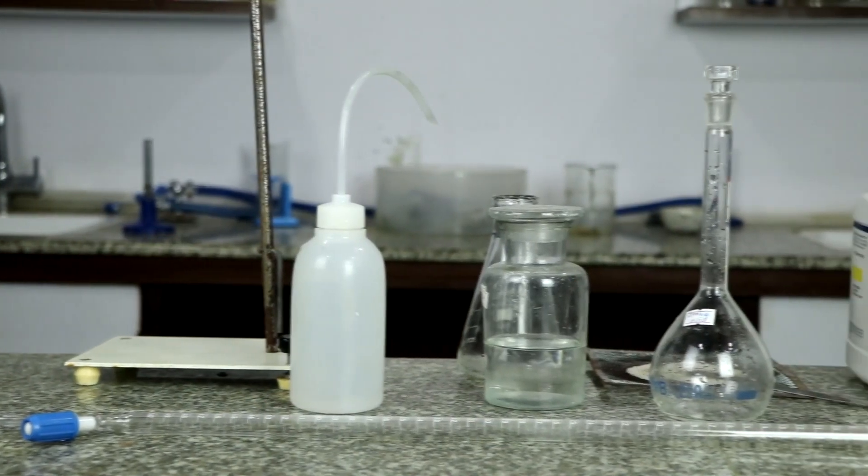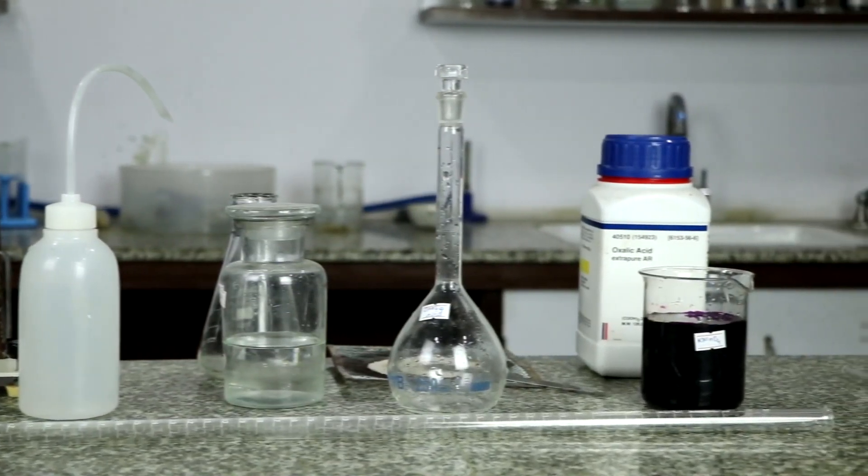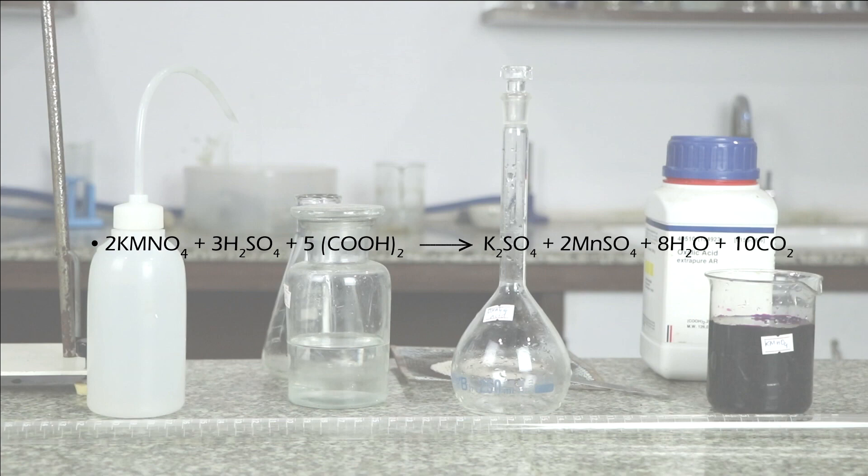The titration that we are performing today is redox titration where oxidation and reduction occur simultaneously. Here in acidic medium, permanganate ion is reduced to manganese ion and oxalate ion is oxidized to carbon dioxide.